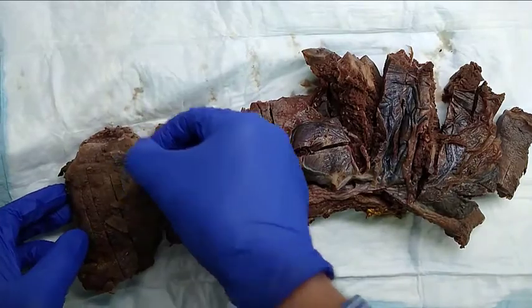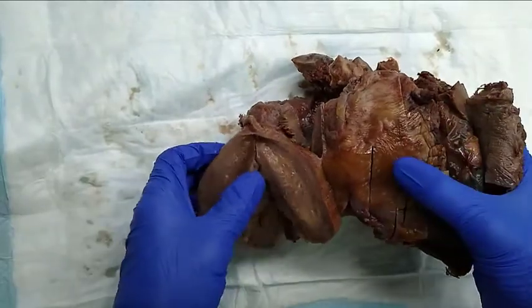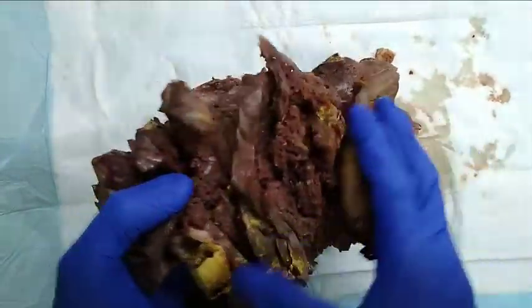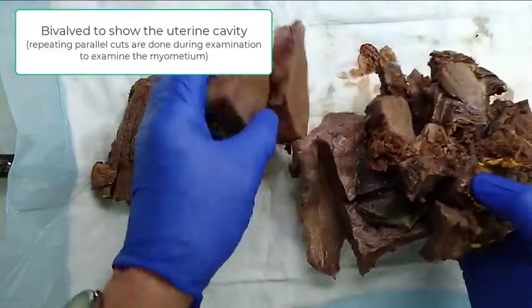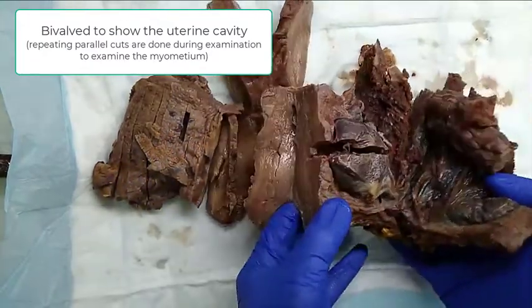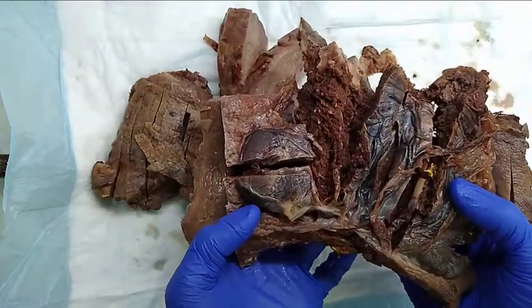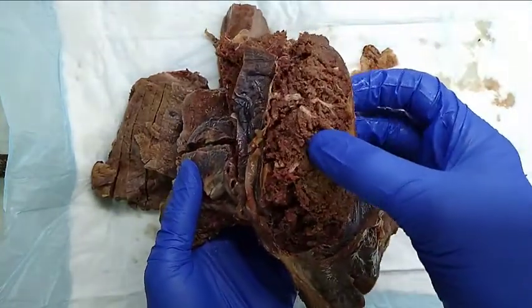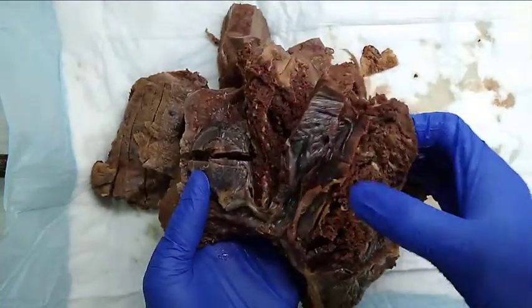So the specimen is actually kind of bivalved. So this is the serosal surface on both sides here with some yellow ink on the surface. And then when it is opened on the left and right sides, and after sectioning, we see the myometrium. But then as you go towards, this is probably the anterior surface, there is a more friable tissue here, which is actually the placenta embedded in the wall of the uterus.